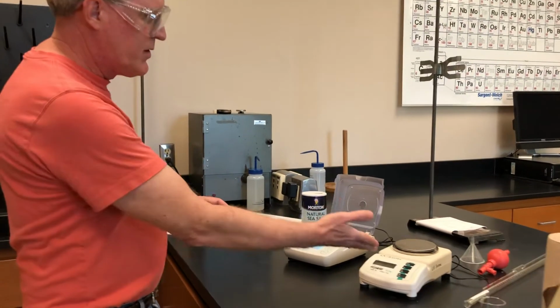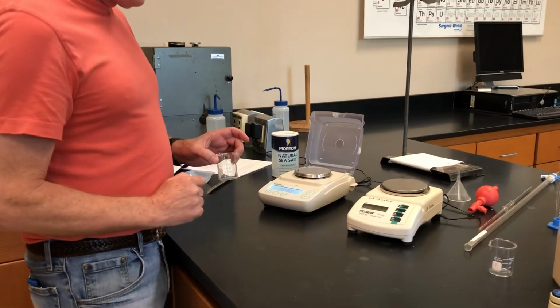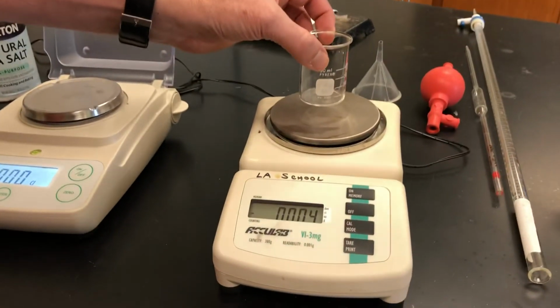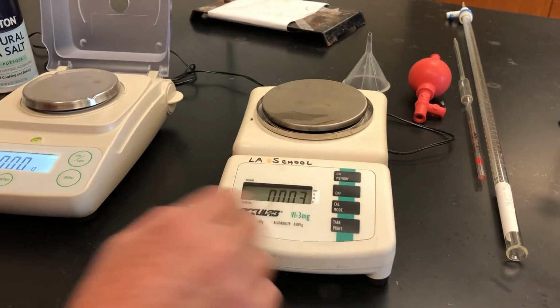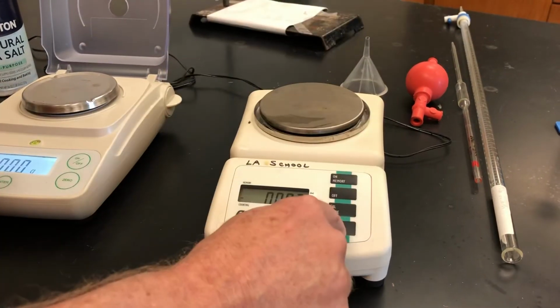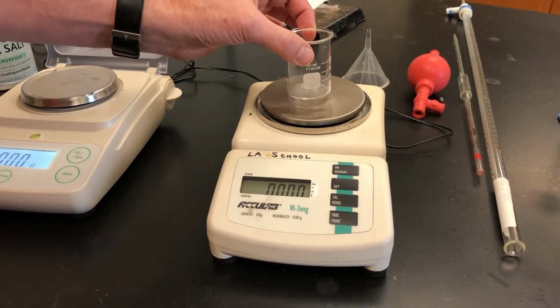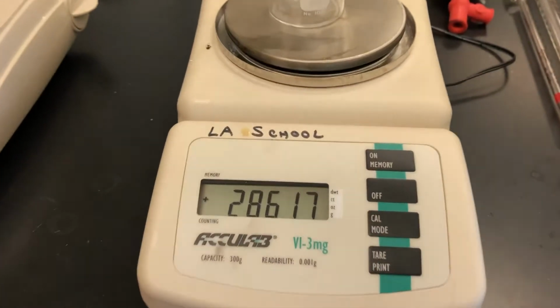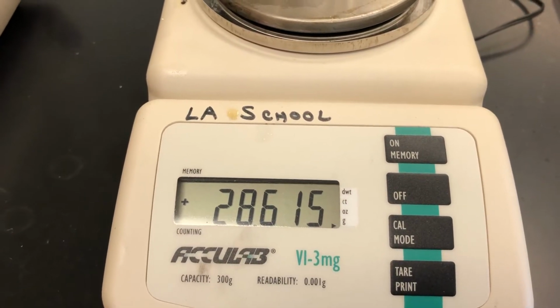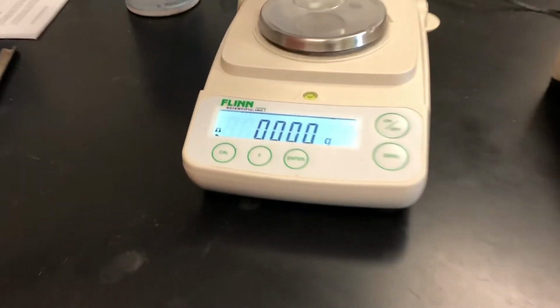So I'm going to come over to this electronic balance right here. I'm going to tare it to make sure it reads 0 again. And I guess perhaps once again show you that electronic balances weigh differently. And again, this one here, I don't know, it's an old balance. Maybe there's air currents blowing on it. I'm going to tare it one more time and that's it. I'm not going to chase the rabbit anymore. So I'm weighing the beaker, this is a different beaker on this balance. And now I'm going to move it over to this other electronic balance. And so you should be recording these values.